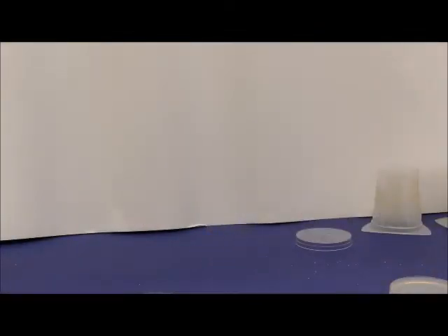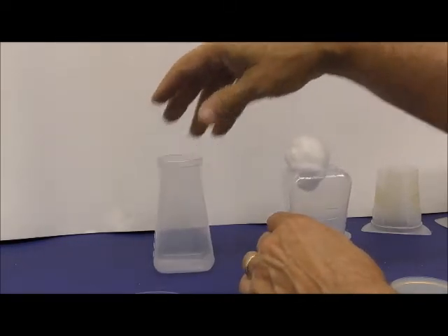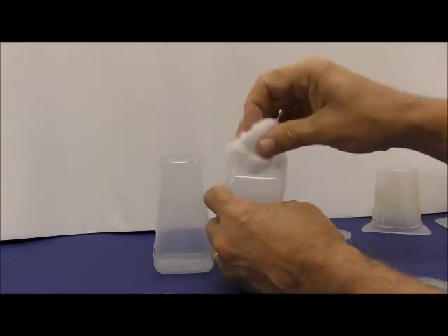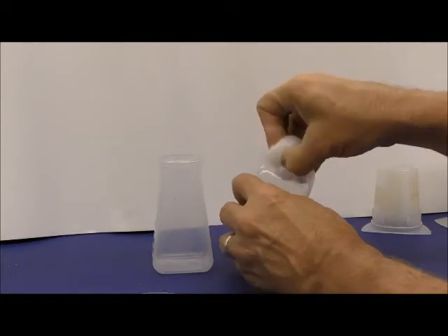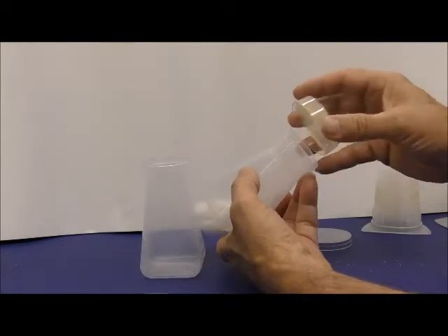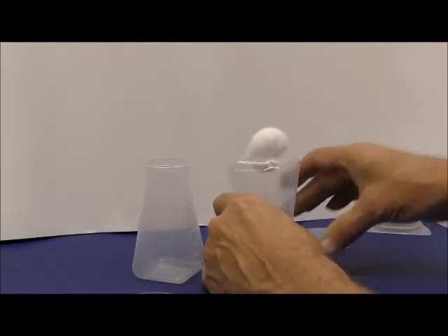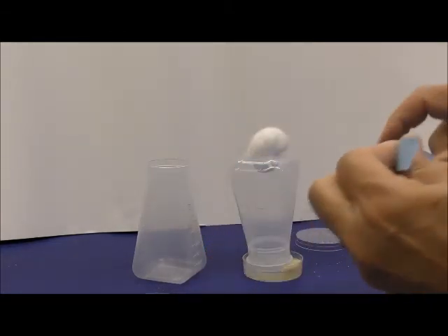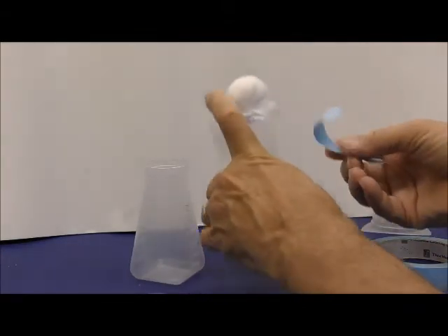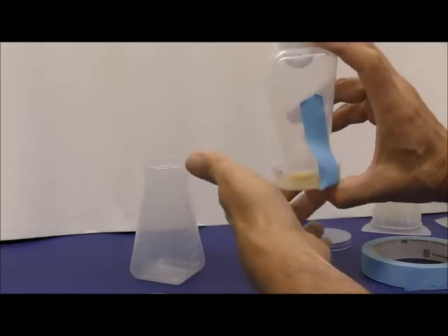Okay. One can also use the fly bottles that would come with flies from fly suppliers, and this is not a bad idea either. You can make a little hole at the top and put your cotton in there to keep air going around. And then one can use these dishes and just gently put it on there, but you've got to make sure the food's in the middle. And then one can tape those as well, with the dog ear tape, and do that on all the sides, all the way around.